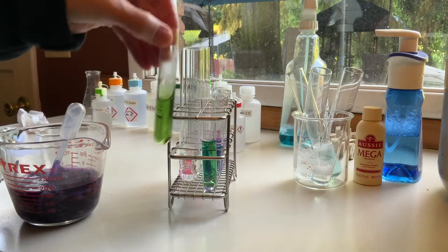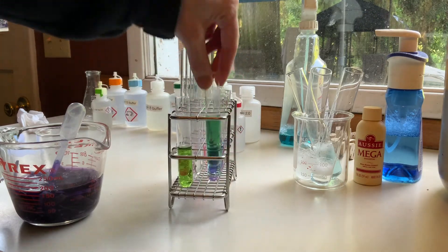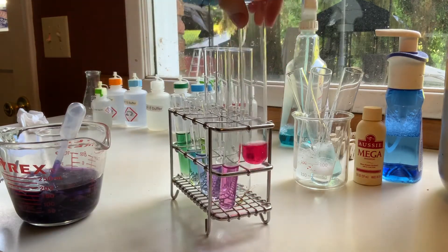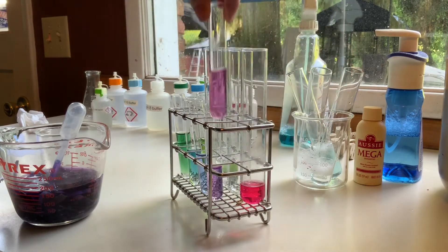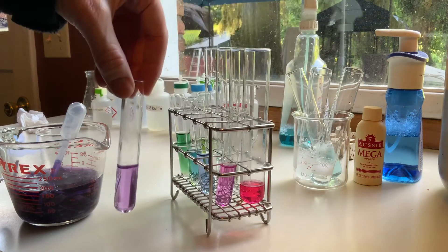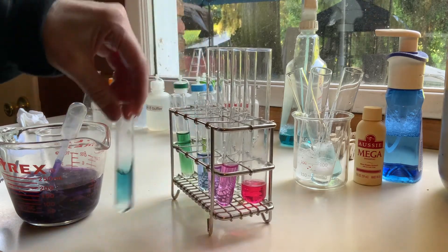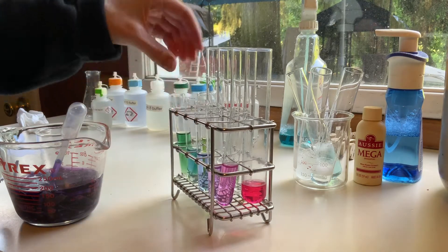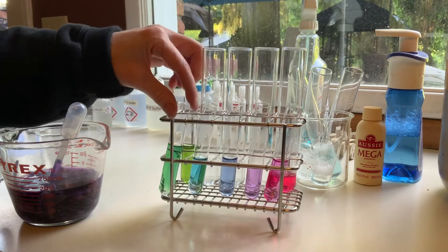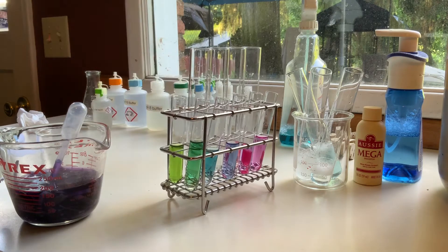This is starting to distinguish itself a little bit — got to be real careful with that one because that one is caustic. As opposed to this one, which is a darker green. You can stop the video to write your descriptions — just pause it. Starting with pH 2, 4, 6 — make sure it's got a plain background on the video. 7, 8 — go with that top color when it's not mixed. 10. Let's give the 12 another minute to develop its color. You can see it's a little different in the greens. 11. I'm going to wash my hands again.